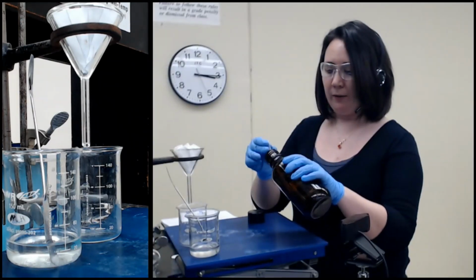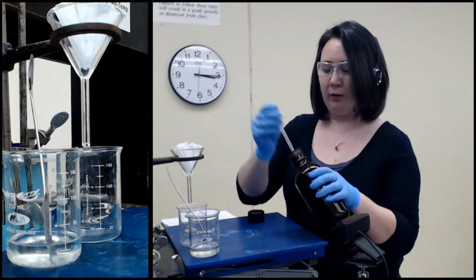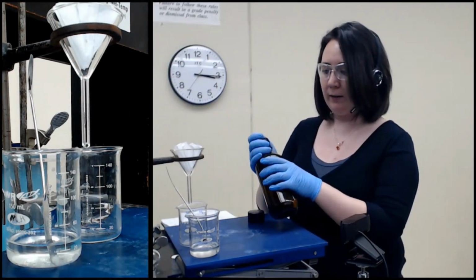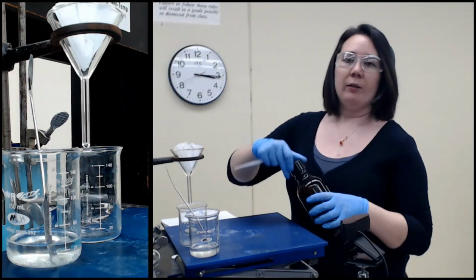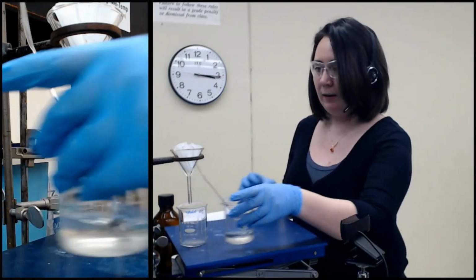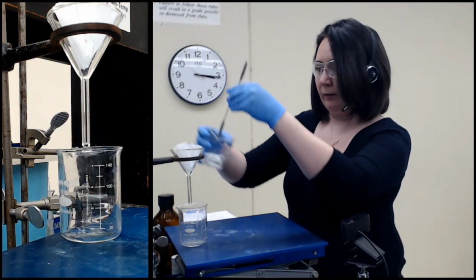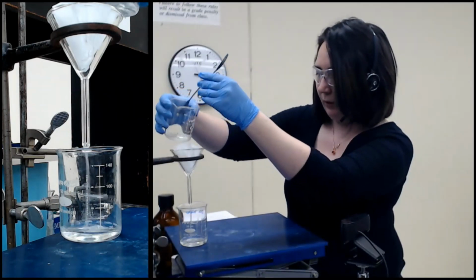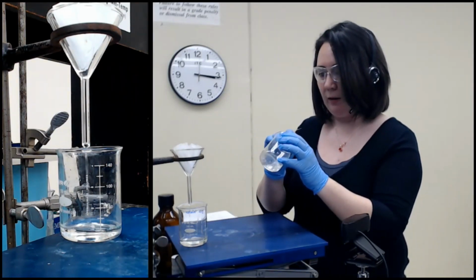And I'm going to wet the filter paper. Not by a lot, because I don't want to dilute the solution I'm working with by too much. But if you recall, there is stuff dissolved in here now, stuff that we care very much about getting back. So if I don't pre-wet this filter paper with the same solvent, some of this liquid is going to soak into that filter paper and it's going to be gone, right? And that's going to be a loss that we're not really looking for. So now I'm just filtering and I'm going to try to scrape the solid.